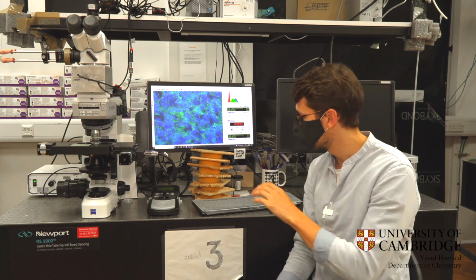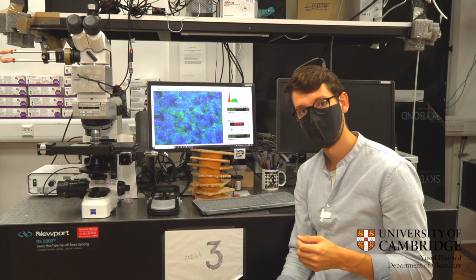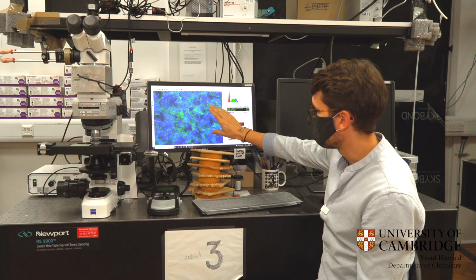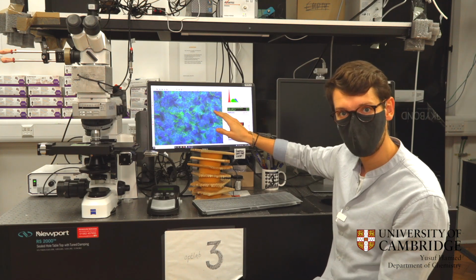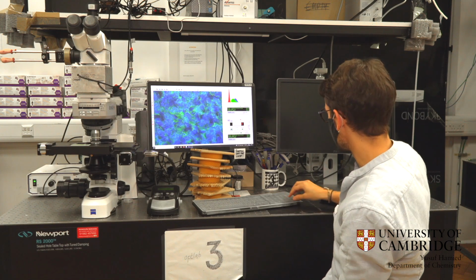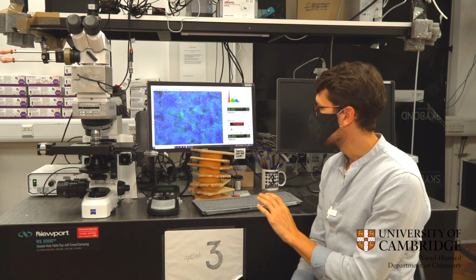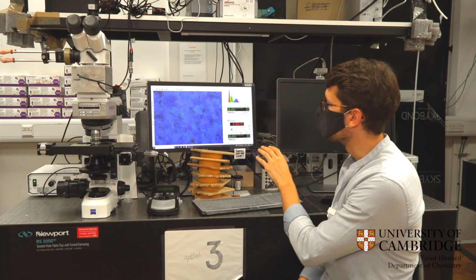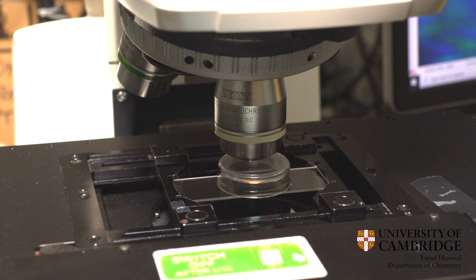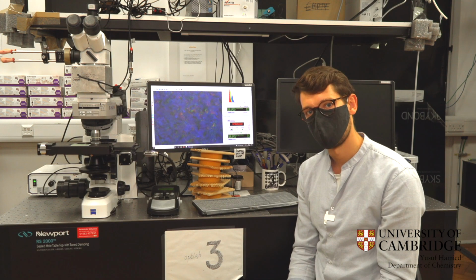And as a consequence, this structure only reflects what we call left circular polarized light. And we can see that on the microscope here. When you look at the camera shot here, you can see that the film appears a lovely blue color because we're filtering for the left-handed light. But if I change the settings so that we filter for the right-handed light, you see that the film in the right-handed channel only reflects a dull brown color. And this is a response that we see in natural structures, and it's something that we can recreate in the lab using our cellulose nanocrystals.